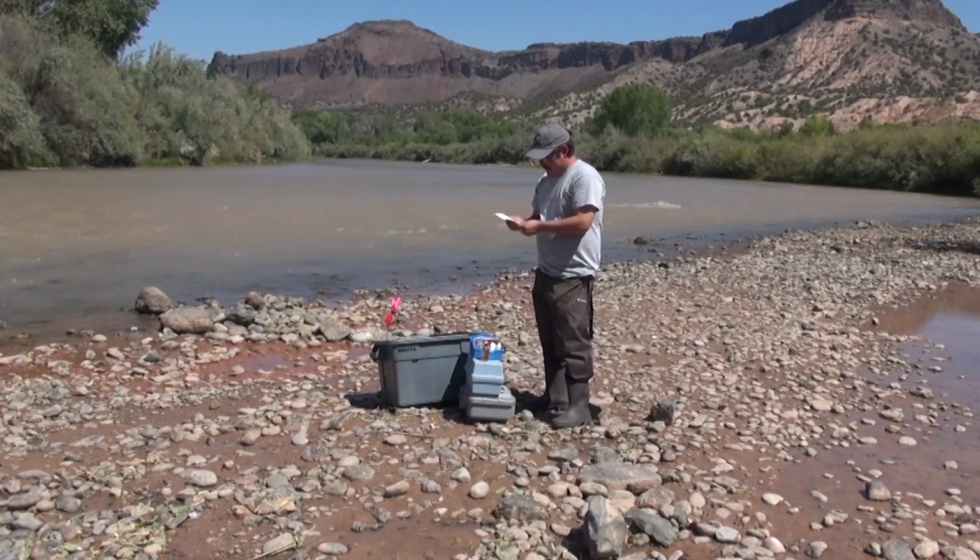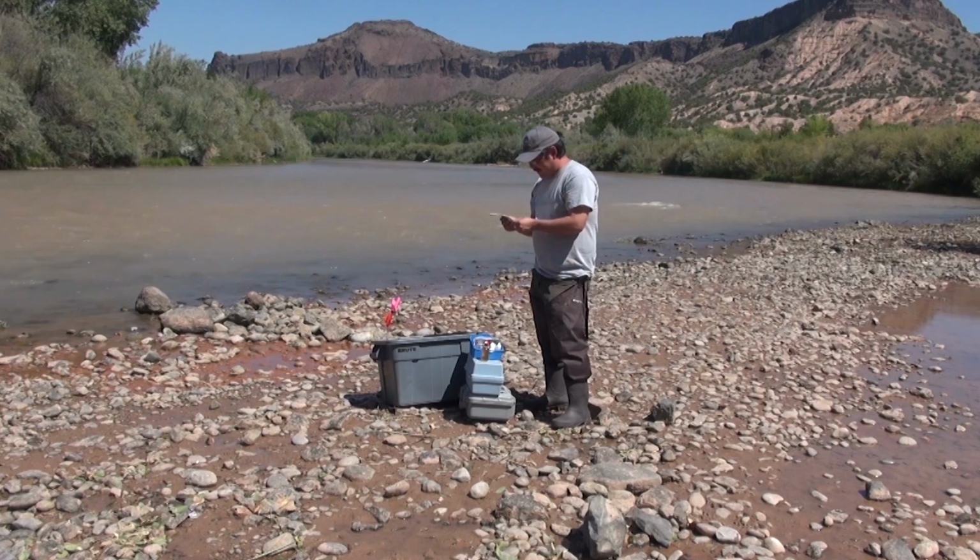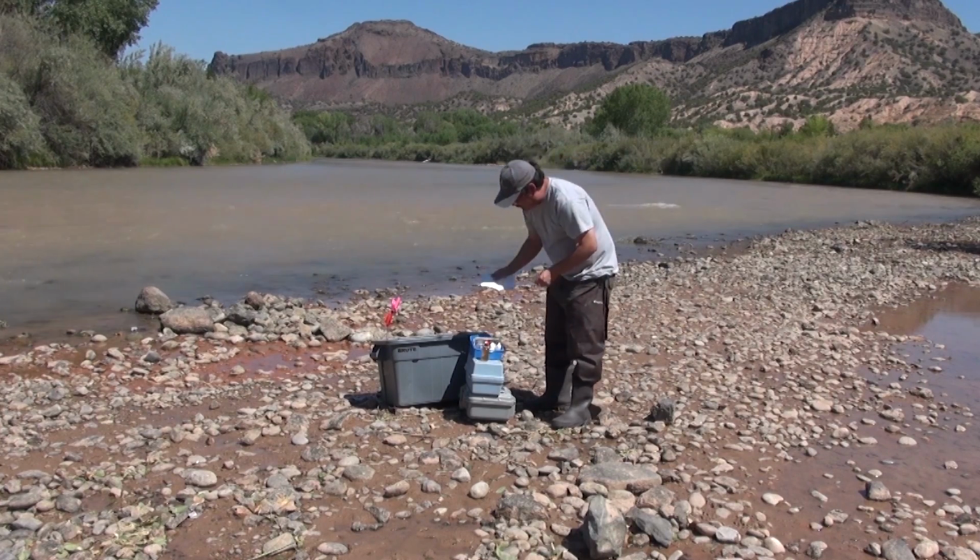So the next part of the test tells me to get the 20 milliliter test tube and fill it up to the 20 milliliter line.